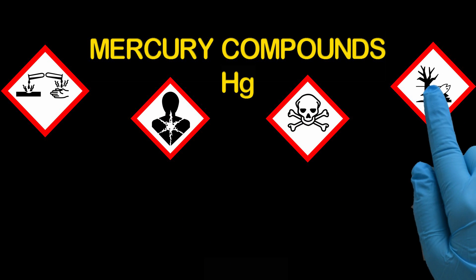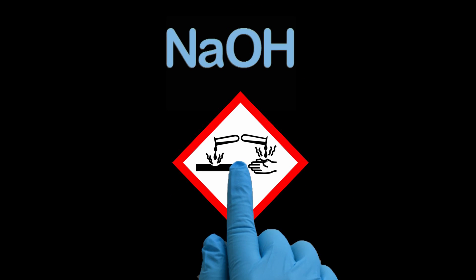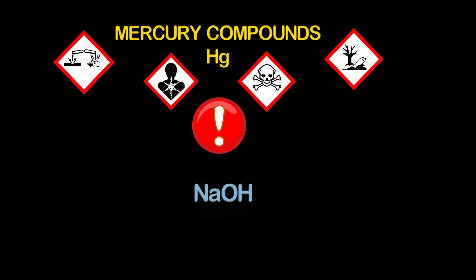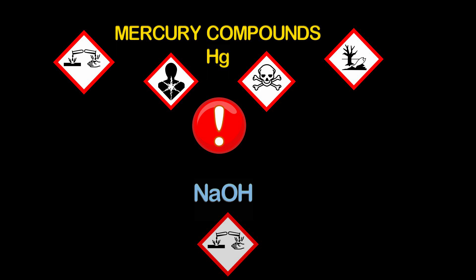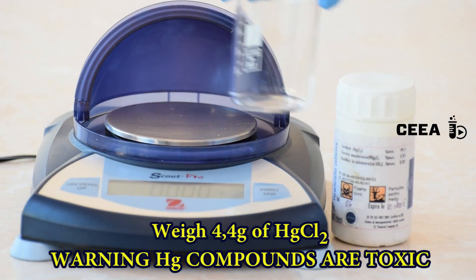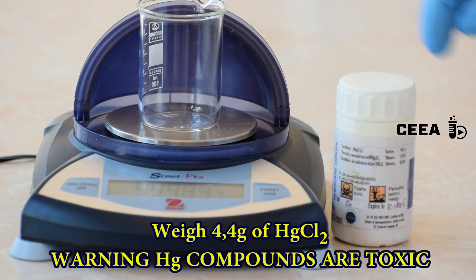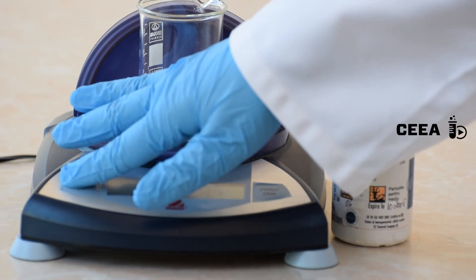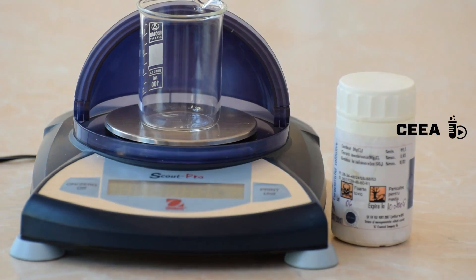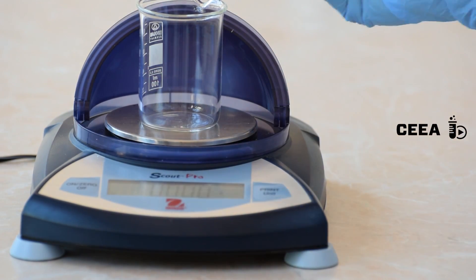The chloride is caustic and harms the environment. Sodium hydroxide is also caustic. We start our experiment by weighing 4.4 grams of mercury chloride, known also under the name of corrosive sublimate.